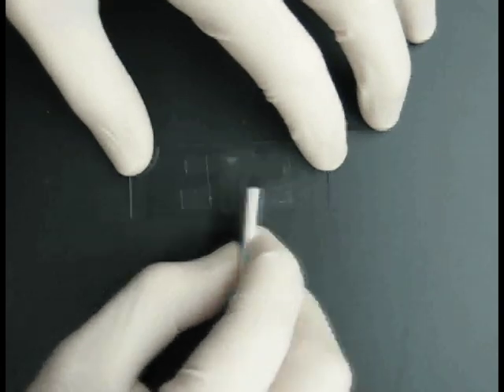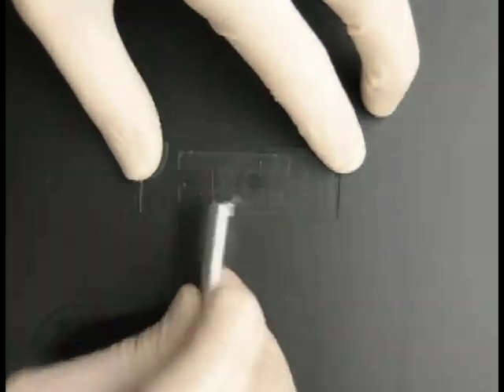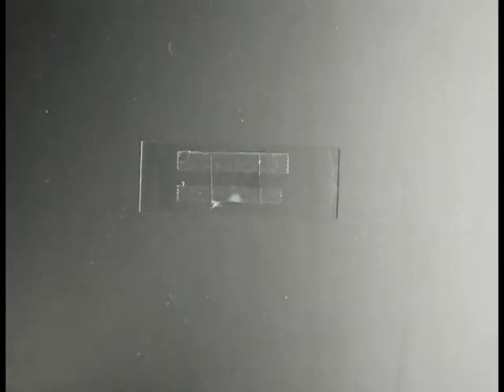As you can see, if you are not over the tape as you smash the slip to the slide, it will break. There you have it, a nice flow cell that will last a long time and can be done ahead of time if you need or want to.